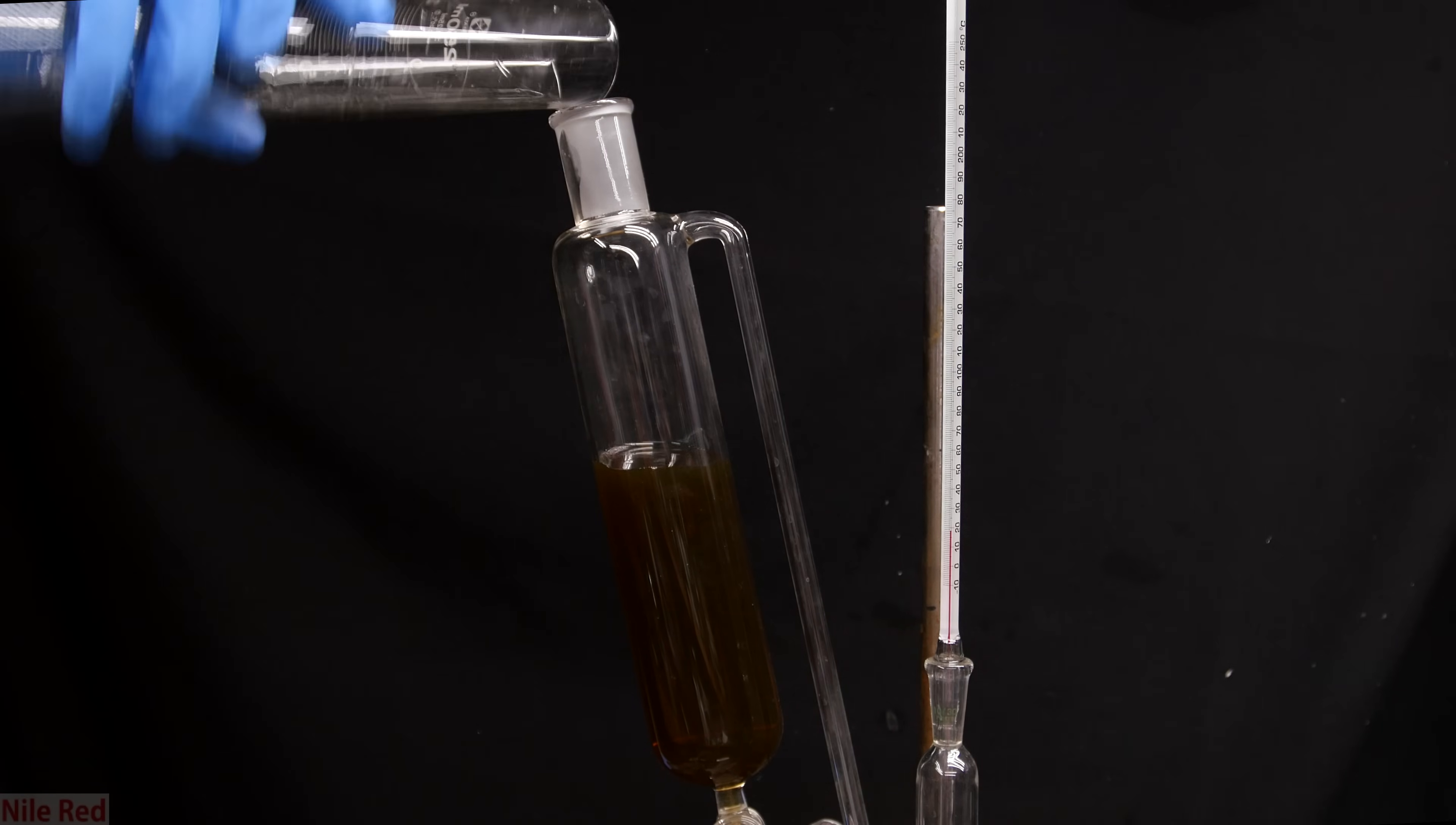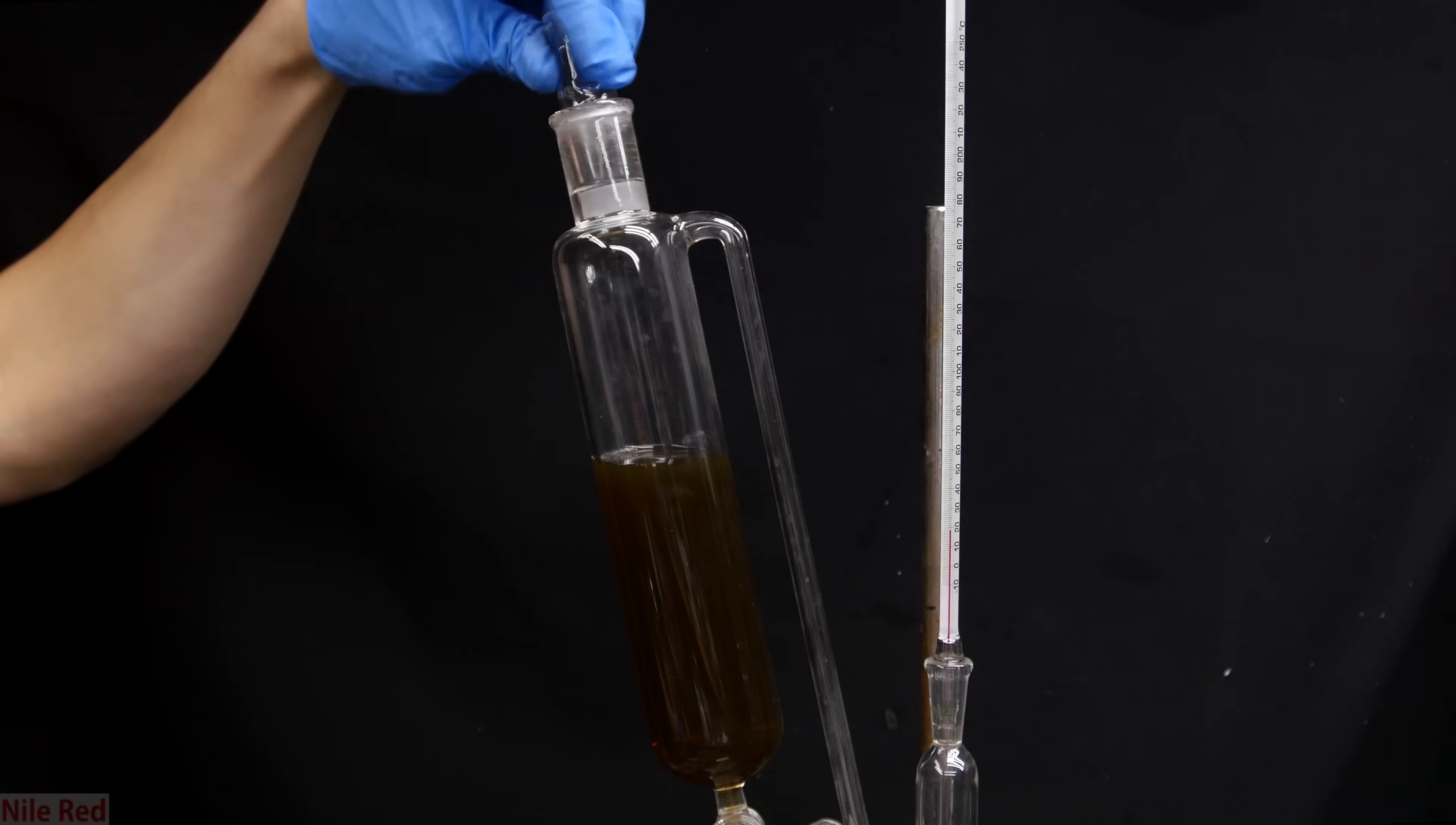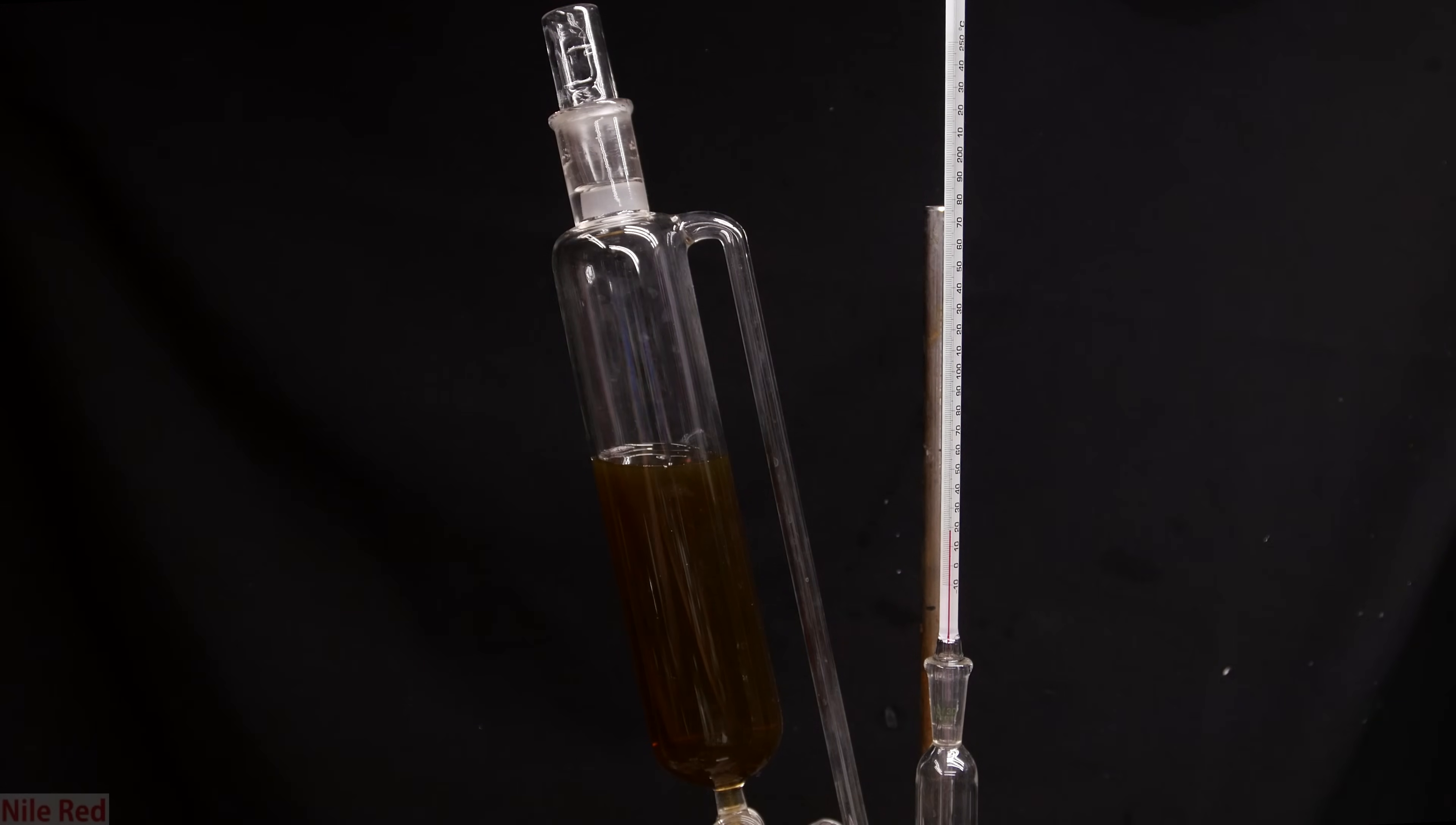The reason we use an addition funnel in general is because the sulfuric acid is what's going to get the reaction going. By using the addition funnel, we can slowly add the sulfuric acid, and we can keep the reaction rate under control. If everything's added at once, it could lead to a violent boil and a pretty dangerous situation.